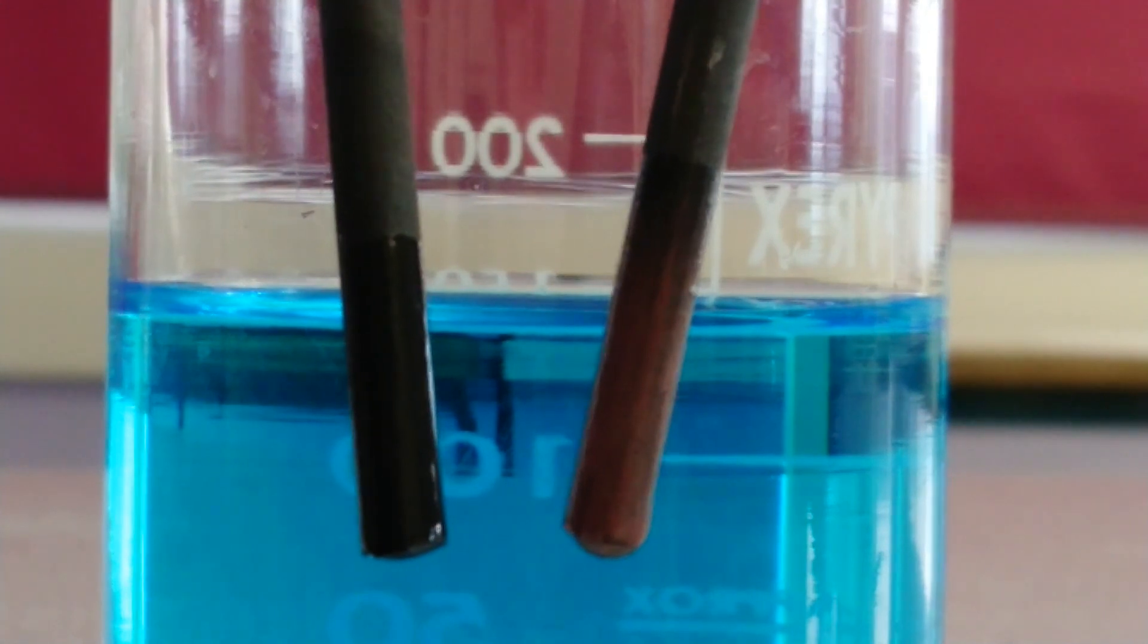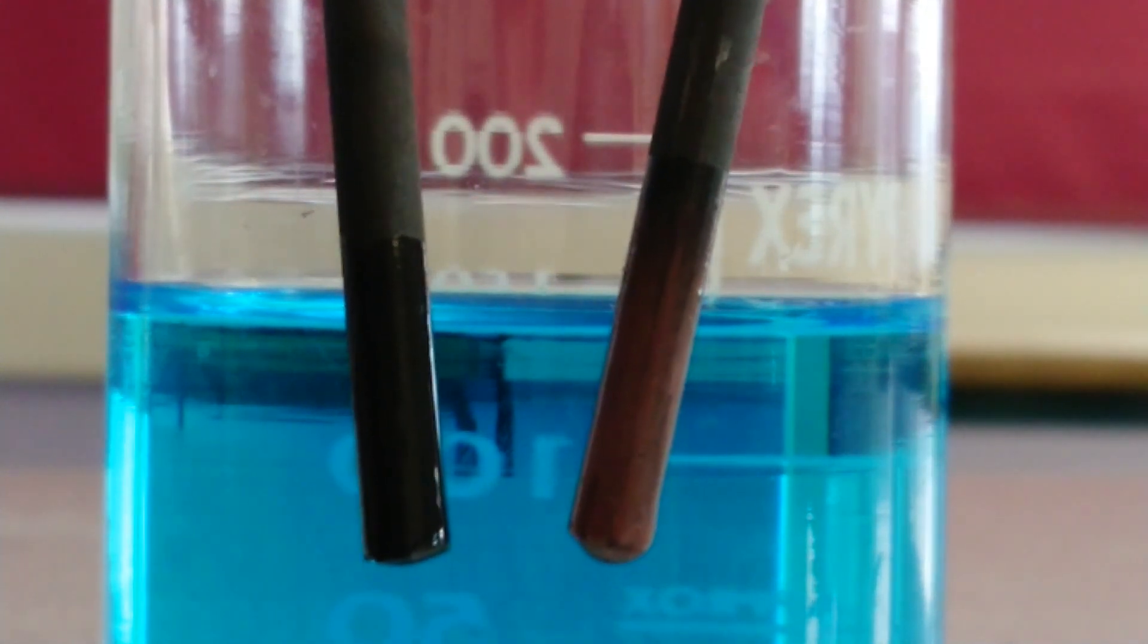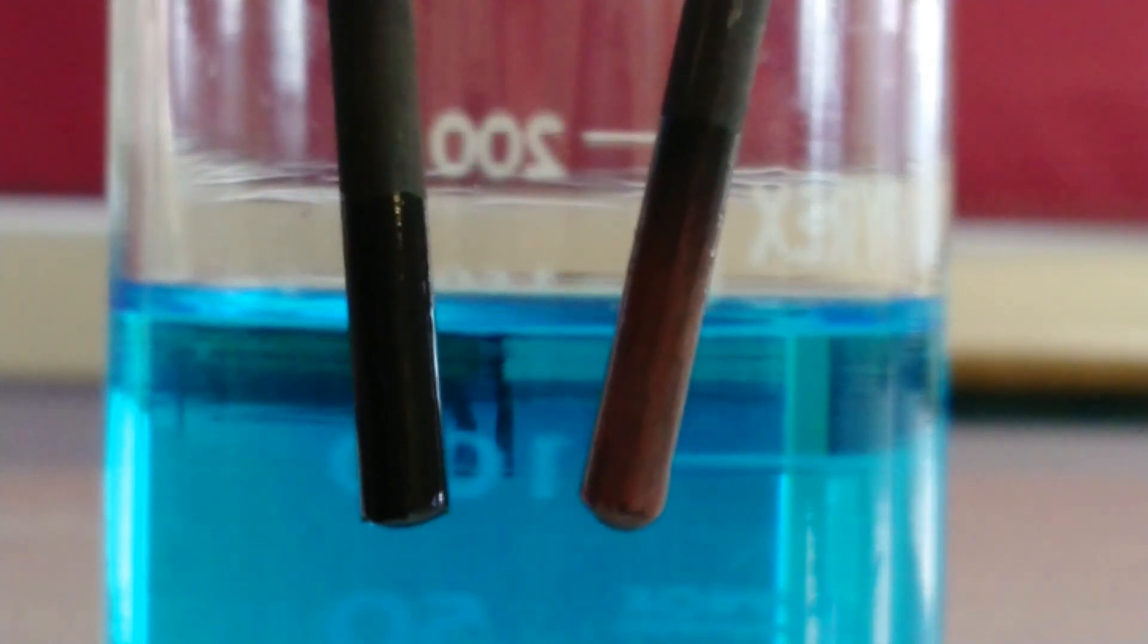If we look carefully at the cathode, we can clearly see we've got copper being deposited on there again. It's fantastic, lovely color.